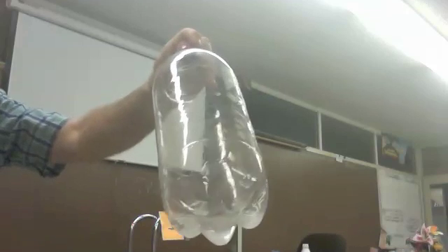It's clear — the Alka-Seltzer is gone. Now here comes the tricky part. Predict what the mass is. Is it more or less? I weighed everything, then I put the Alka-Seltzer in and put the lid on, and now I'm weighing it again. It's 106.47 grams. Even though the Alka-Seltzer is gone, it weighs the same.